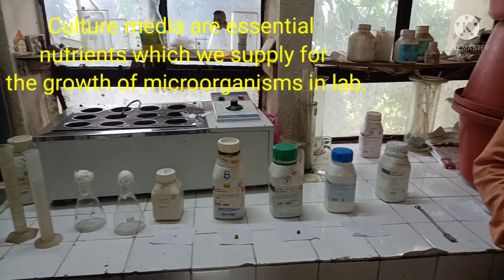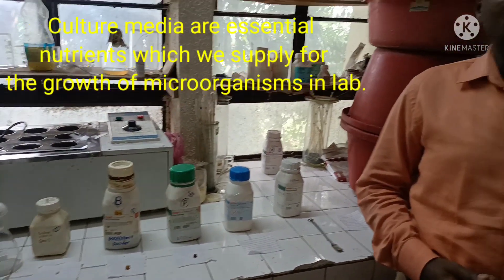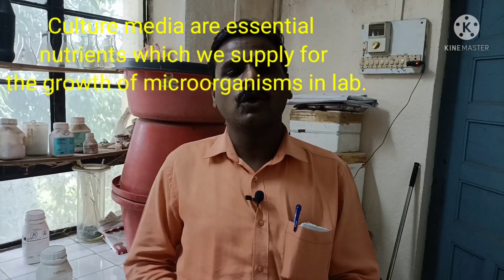Culture media are the essential nutrients which we supply for the growth of microorganisms. The culture medium contains all the essential nutrients and raw materials. In the microbiology laboratory we grow and cultivate microorganisms, and for their cultivation we have to provide them with essential nutrients. Bacteria vary in their nutritional requirements — the nutritional requirement of all microorganisms is not the same.